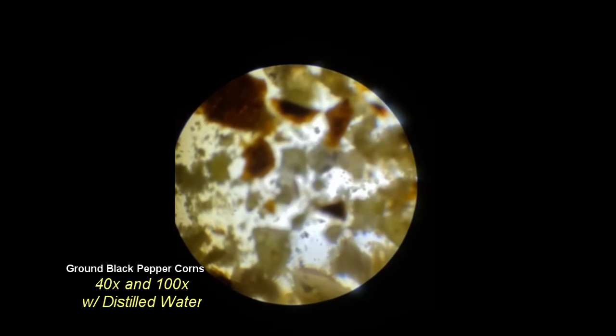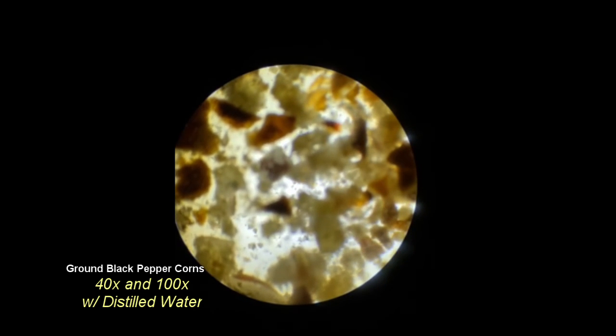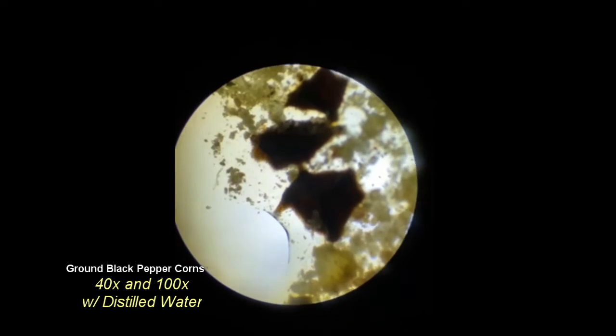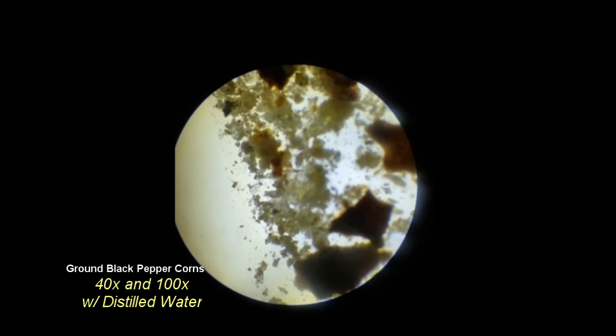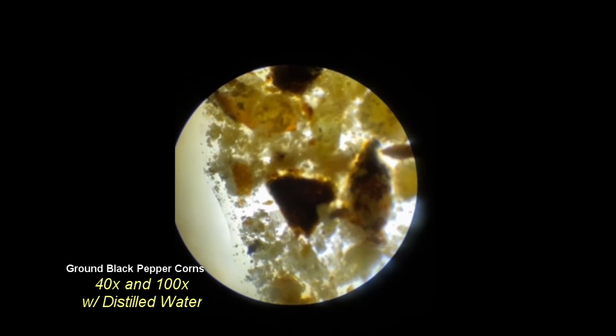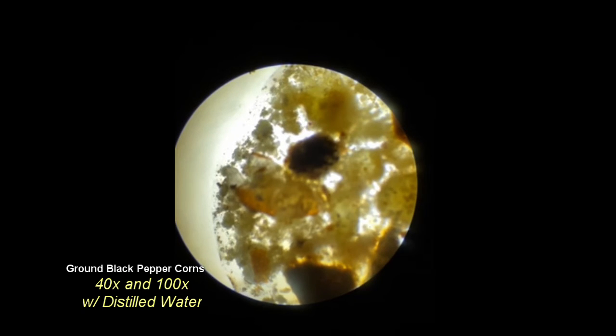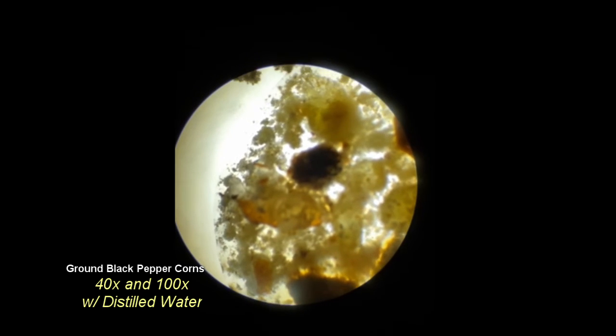In the final clip, the ground black pepper is visualized on the slide while distilled water is added. By far, black pepper had the most variability in particle features. During the main separating solutions lab, after the first pass of filtration, the remaining water was dark brown.